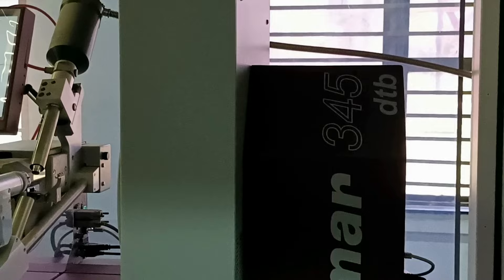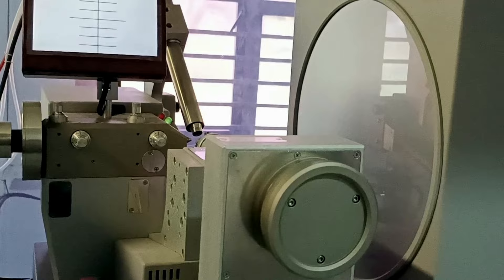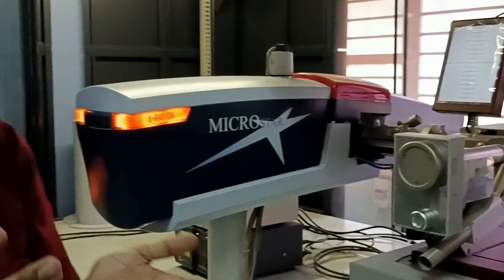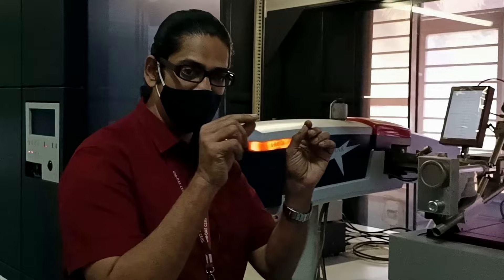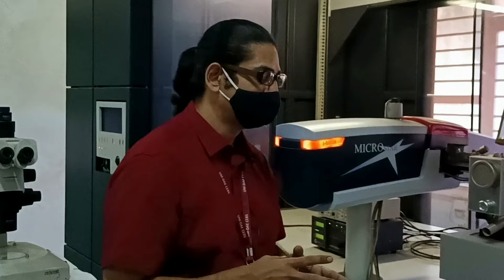It's a circular detector, not a CCD detector. You also have the option of a square detector. How do you choose which is better? There are different schools of thought. With the square detector, especially for high-resolution data, you get those high-resolution spots towards the corners — that's the advantage. I'll also explain the importance of the square detector in a different segment.